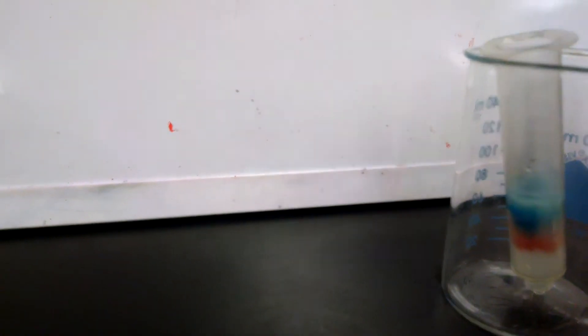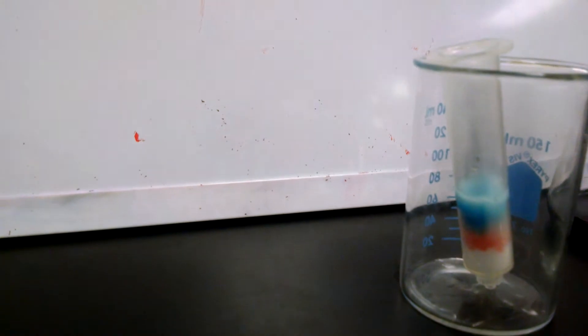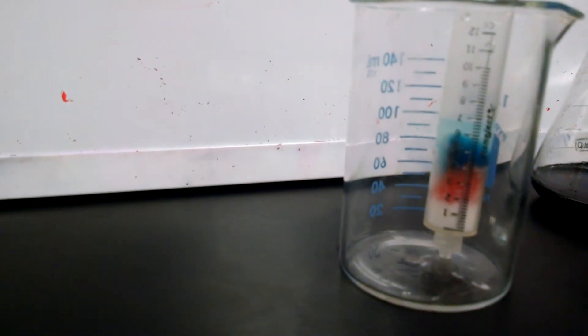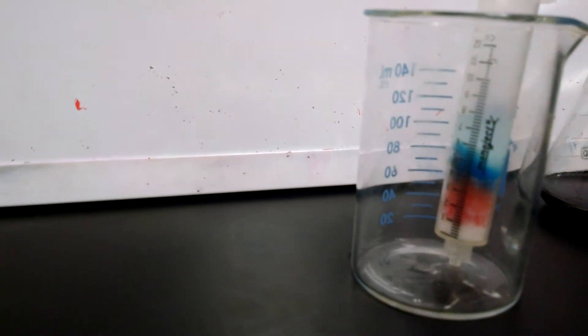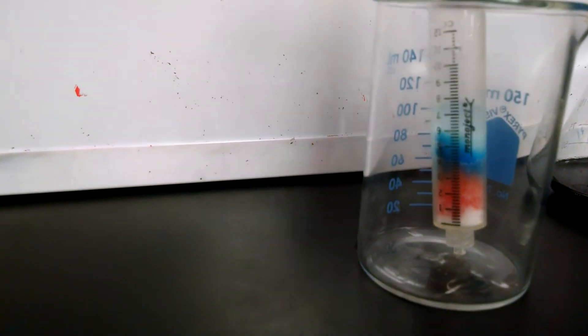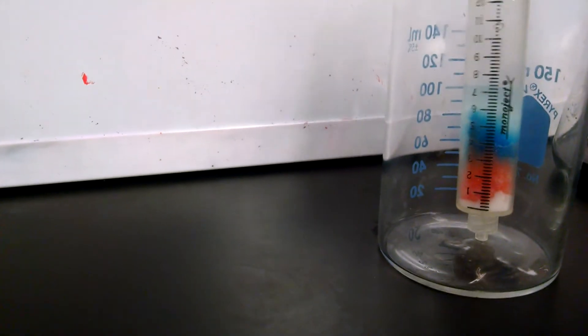I'm going to add some more and we're going to let that separation continue. And the nice thing about this method is we can actually collect the red color. I'm just going to kind of gently push the solution through.